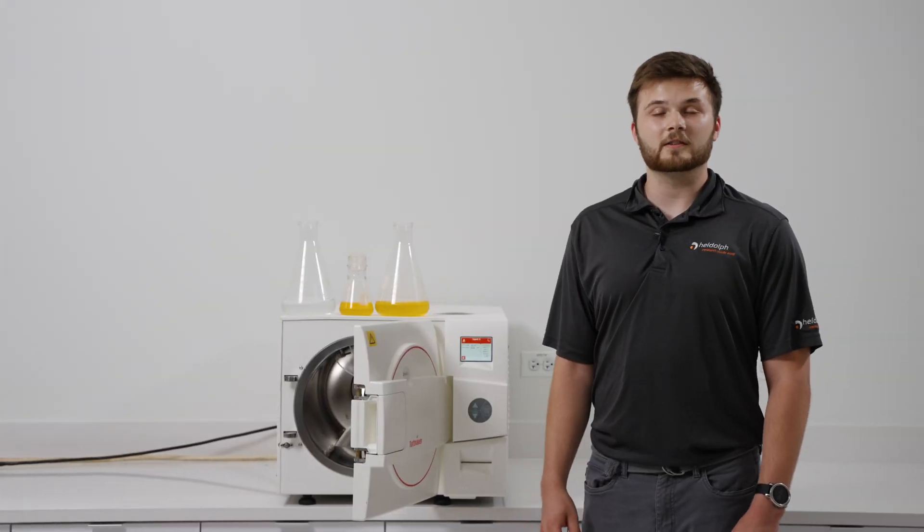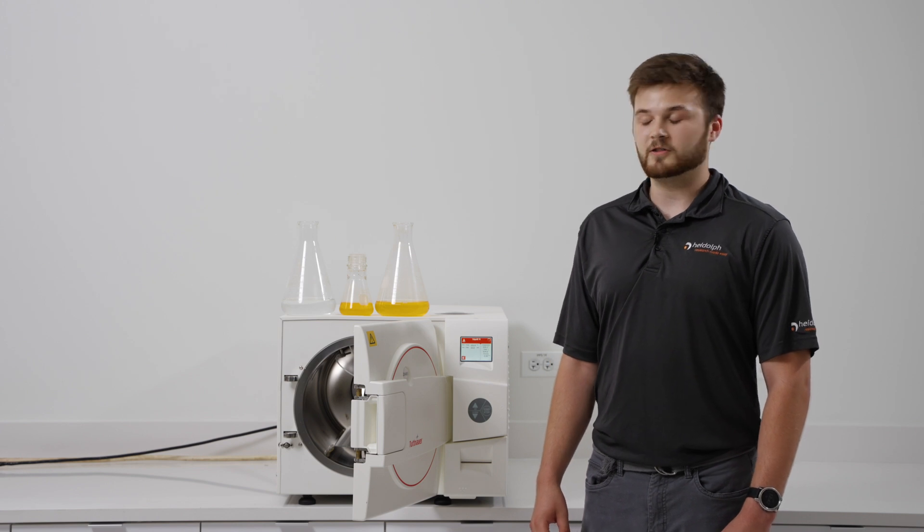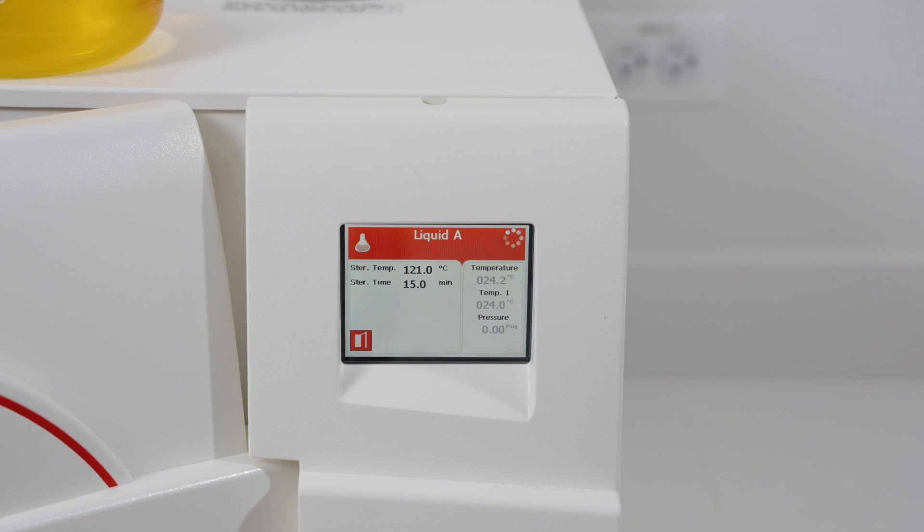For this video, I will be referencing the liquid A cycle, which comes pre-programmed on all LabLine autoclaves. The liquid A cycle is a 15-minute sterilization at 121 degrees Celsius.